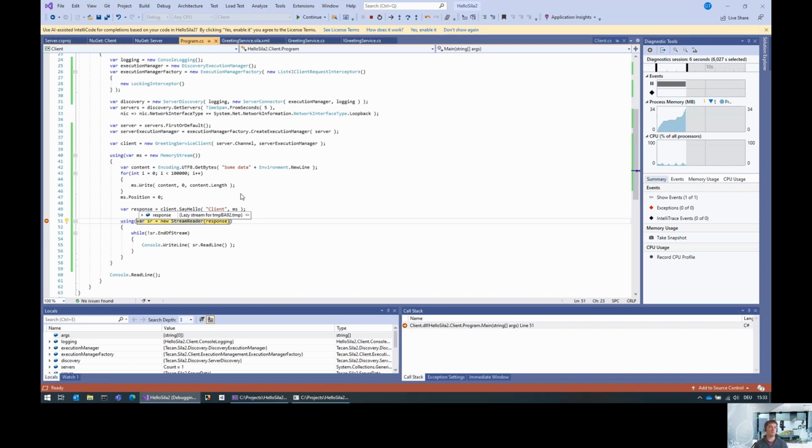You basically only have to type your contracts with streams or byte arrays or file info objects, and then the SDK is going to do the rest for you.